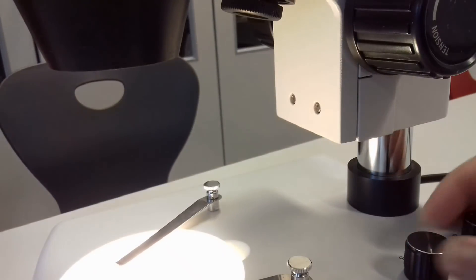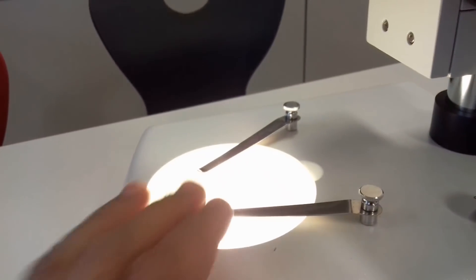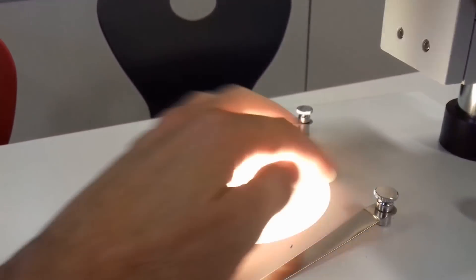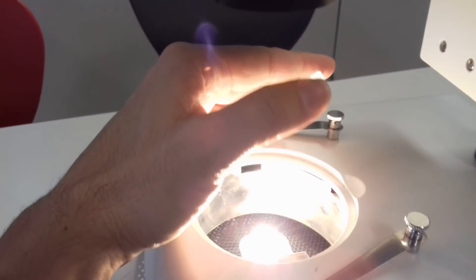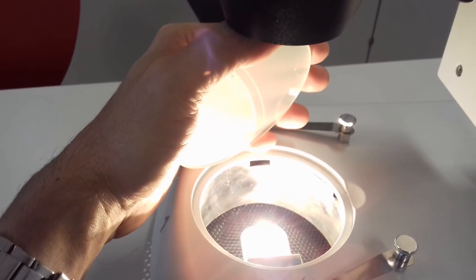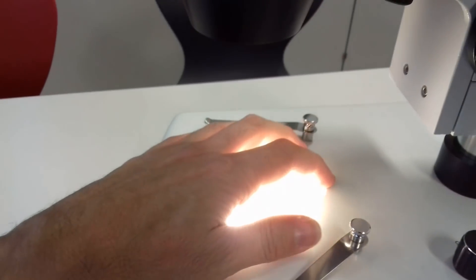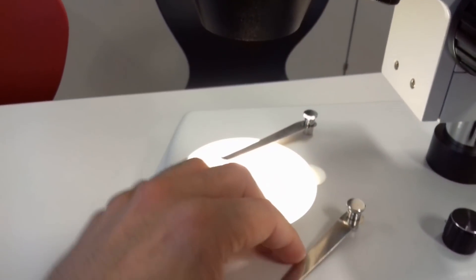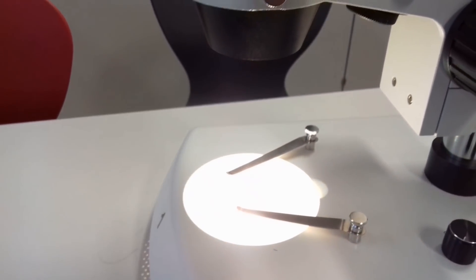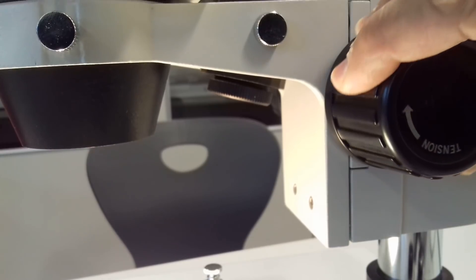And that is now the lamp from the bottom. And here there is a glass plate and I'm removing the clips now and the glass plate. And you can see that there is a lamp in here. Some of them have halogen lights, others have LED lights. I would say almost a little bit a question of taste, but that is basically a very common feature.